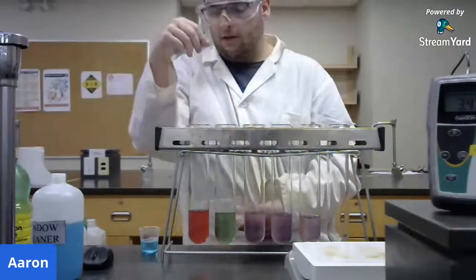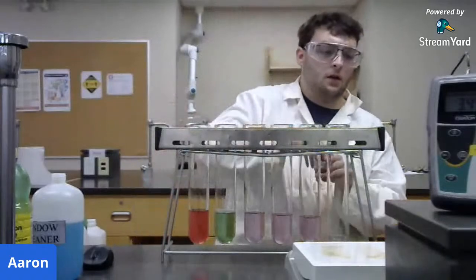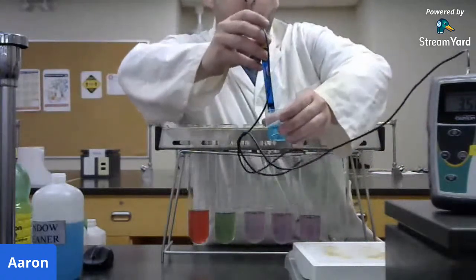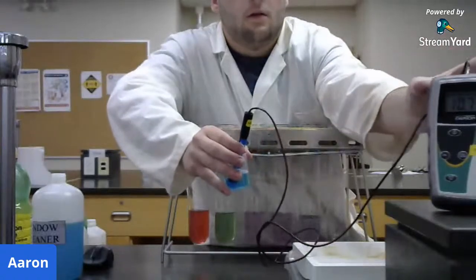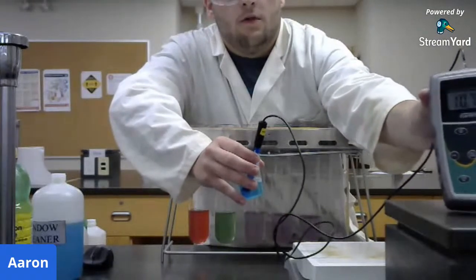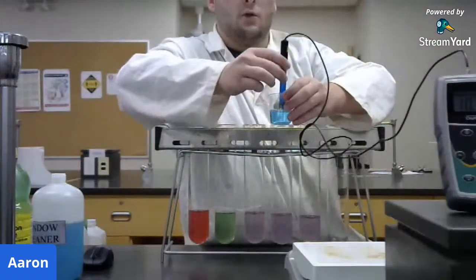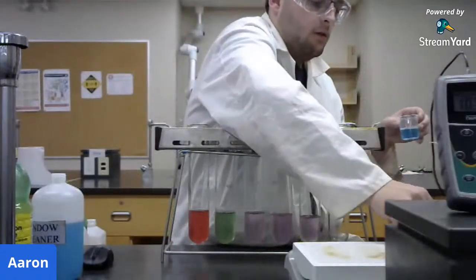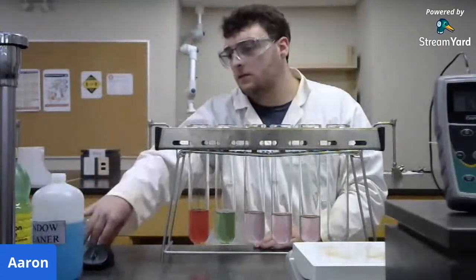So we know that it's not the same pH as the lemon juice, but what is the pH? So we'll go back to our pH meter here. We'll put the electrode in. Let's see, 10.7. So remember, the scale goes from 0 to 14, 0 being very acidic, 14 being extremely basic. So 10 is on the high side, so window cleaner is basic, and it turns green in our indicator.